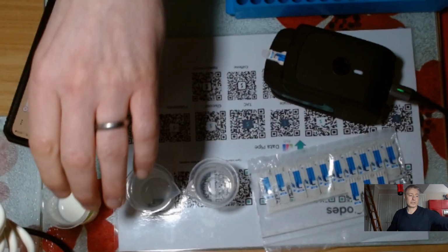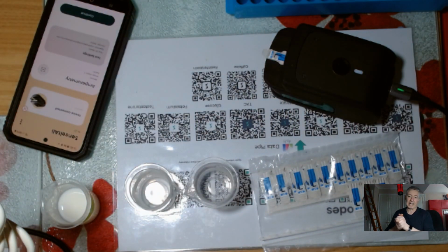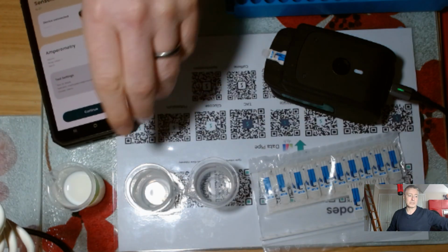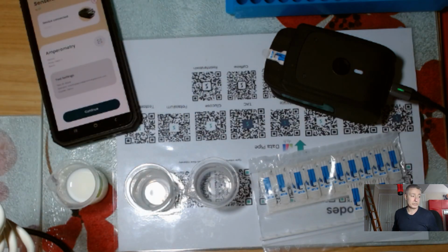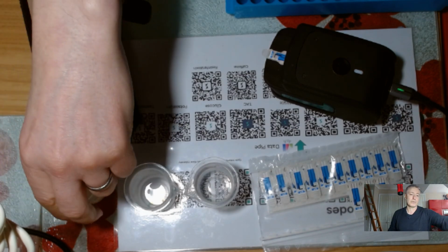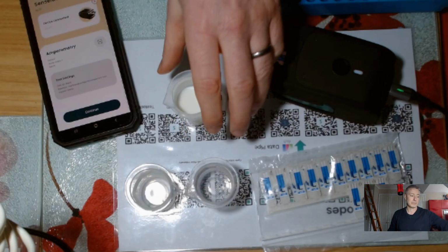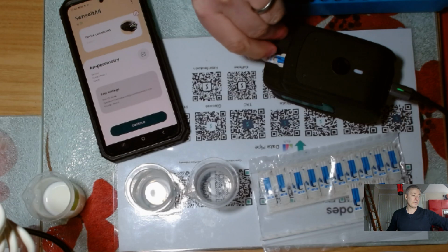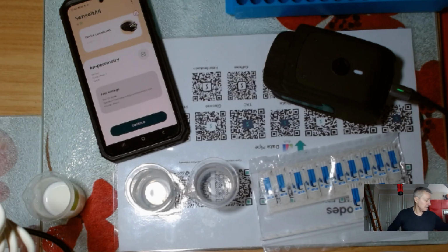I'm actually going to end up proving the assay, let's say, in a real sample. I happen to be using milk. The nice thing about milk is it's a real world sample. It's not a synthetic sample of just buffer, which is just pH and salt. There are lots of different interferences and materials in milk, so it's not a bad thing to prove out an assay in. So I'm going to prepare the peracetic acid, and also prove the principles of an assay using actual milk. So just watch for that.